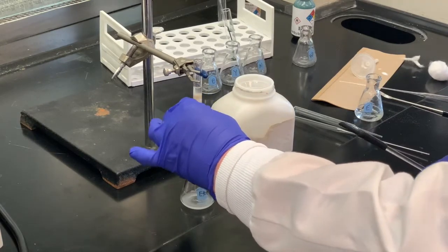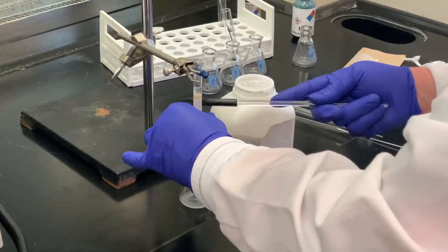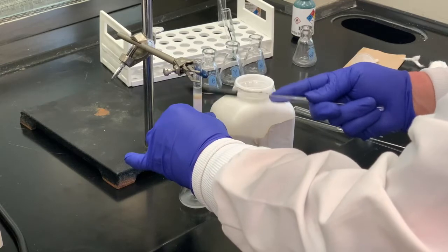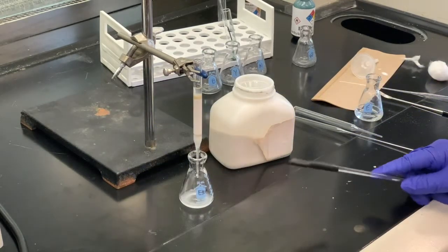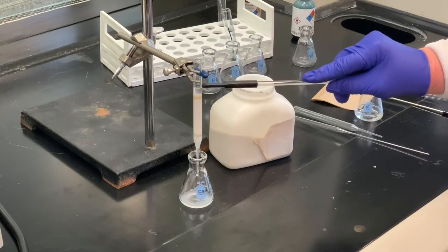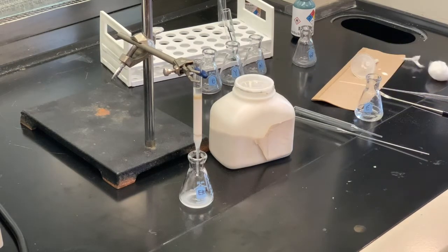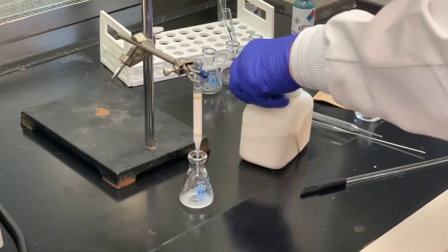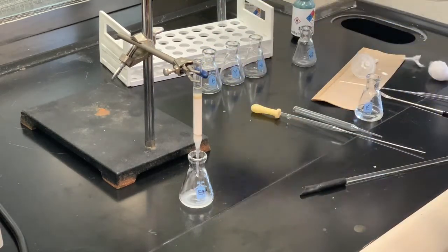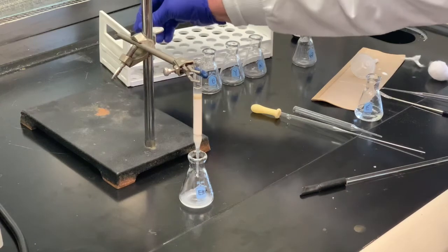So what we need to do now is to let that solvent drain to right above the sand, and then I will add our sample of the dye stuff that I've already measured out in a test tube.